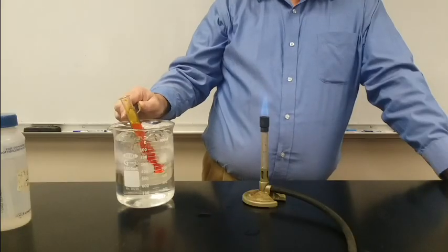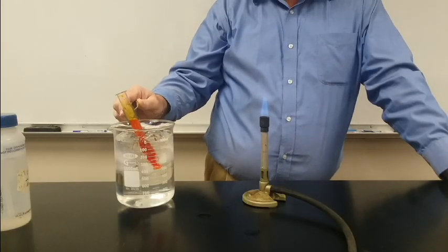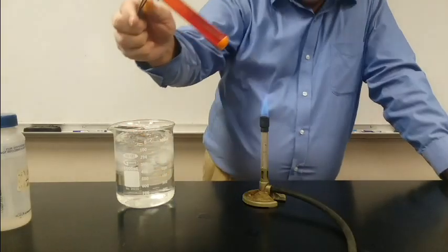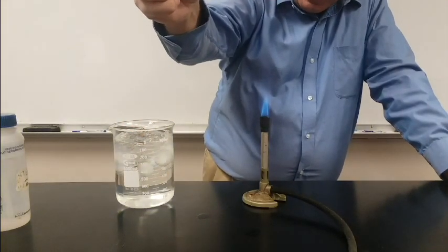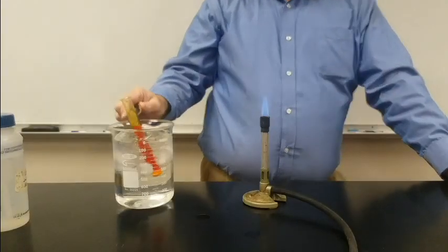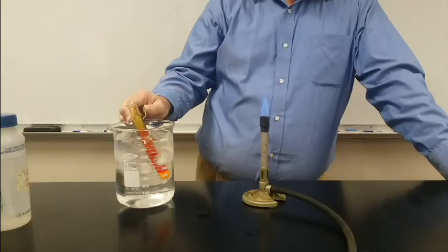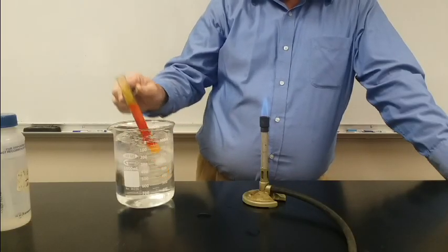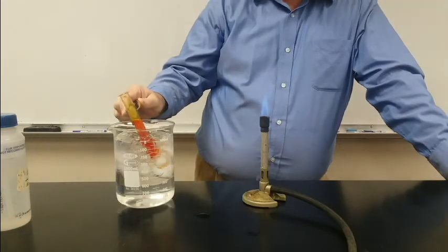As I cool it, some of that solid that the heat got to dissolve is going to come out of solution. It really doesn't take that long — you can already see some solid at the bottom of that test tube. It's come out of solution because the solubility has dropped enough that some of that solid has to come out. And the more I cool it, the more solid comes out.